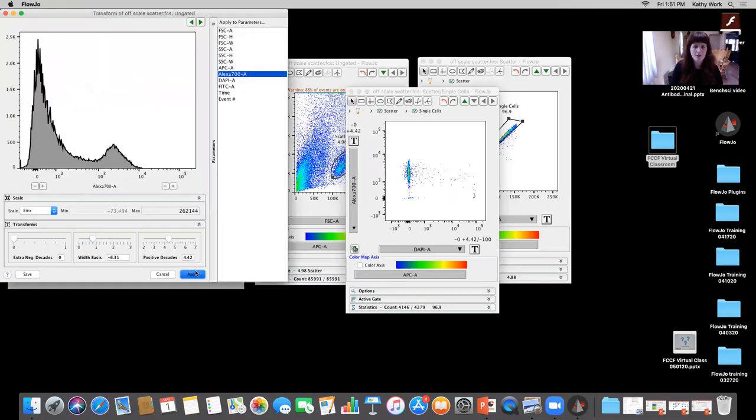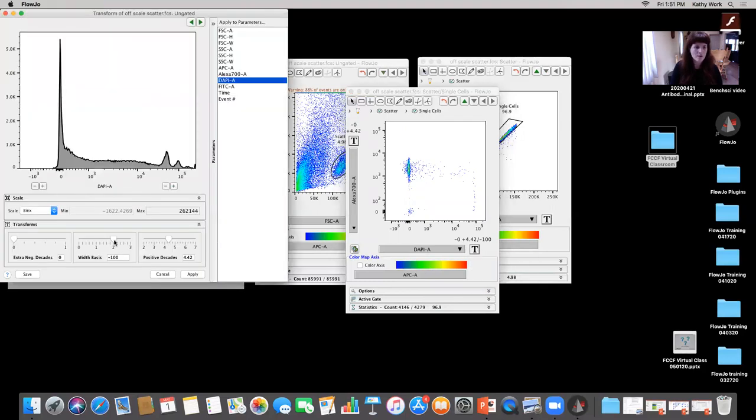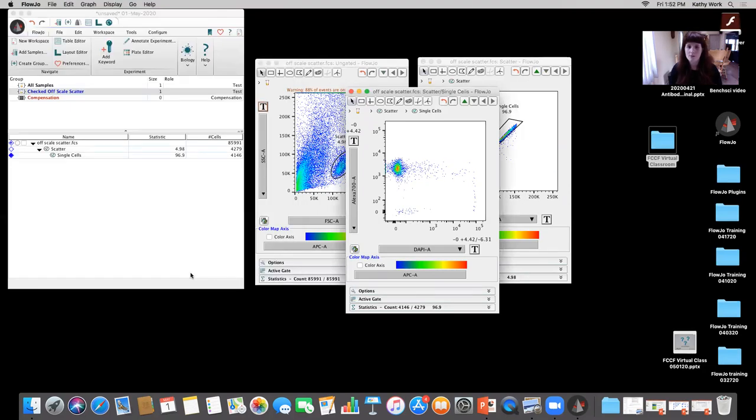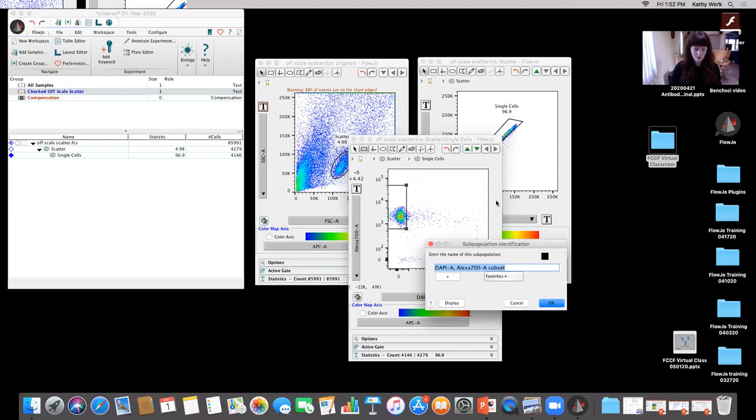Again, I think everyone is gonna think I sound like a broken record if you've heard me in these sessions before, but I don't always have the appropriate controls for these classrooms because we're locked out of the lab for just a very tiny bit longer now. And unfortunately, we don't have a lot of access to everything I would like, okay? But these down here are the negatives. These are the Alexa 700 population of interest that they wanted. So I'm gonna say cells of interest right here.